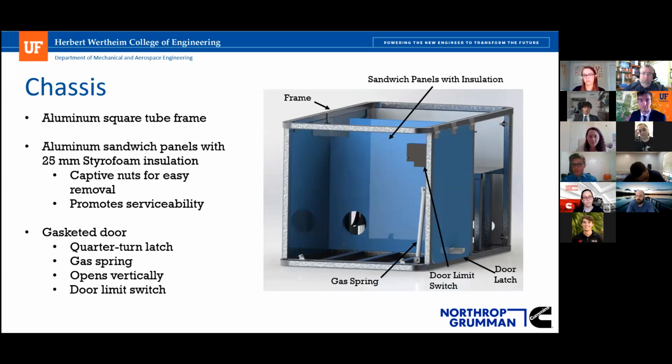Talking a little bit about the chassis of the incubator, we started off with an aluminum box tubing frame that's all welded together. This was chosen over some other options like 80/20 because it is a lower off-the-shelf cost for the material. It's also a lot stiffer. A welded joint is always going to be stiffer than an angle bracket putting this thing together. It also reduces our assembly time.